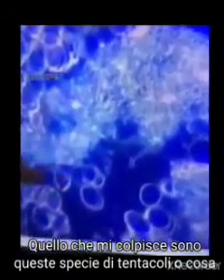Okay, what are we looking at here? This is very bizarre. Very bizarre. I have no answer. I sent this photo to doctor friends and asked if they see similar things, and they say yes. I really don't know what this is, and what's really bizarre is these kind of tentacles, or what is it, that come out there?